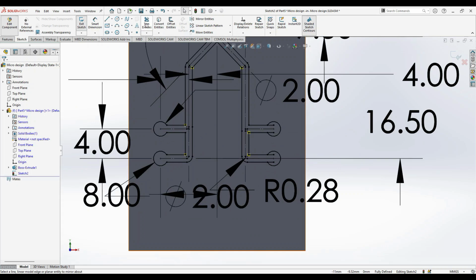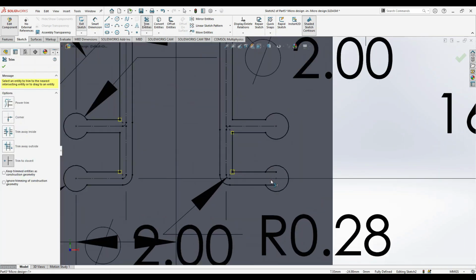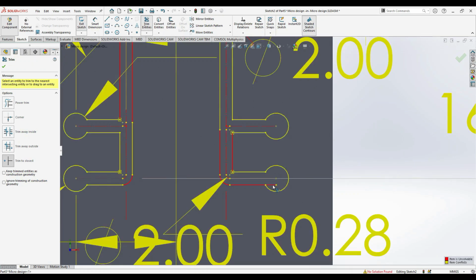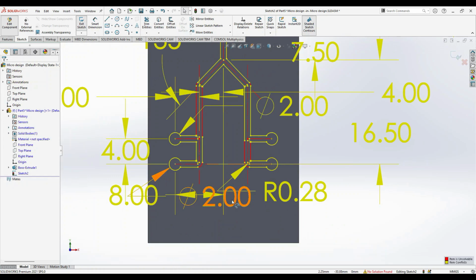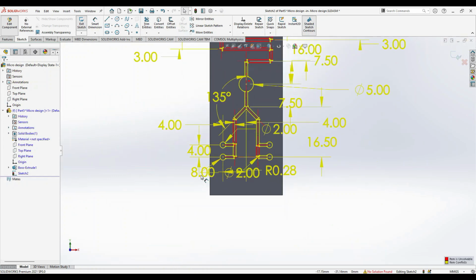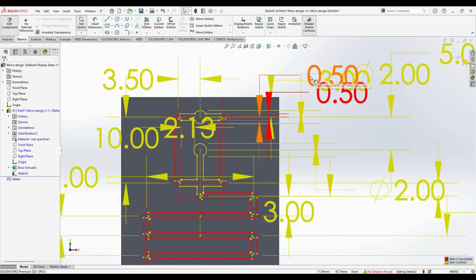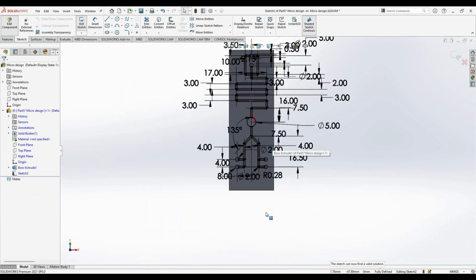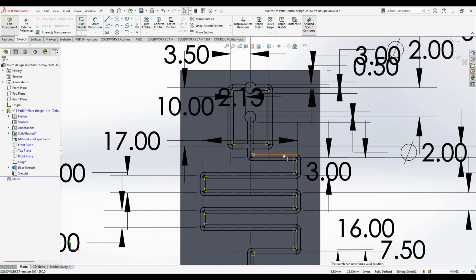And then trim this entity, and also this one, this one. Do not panic seeing all these dimensions. The only thing is we have given over dimensions, so delete any one of the dimensions. So yes, now I think we are done with the design.